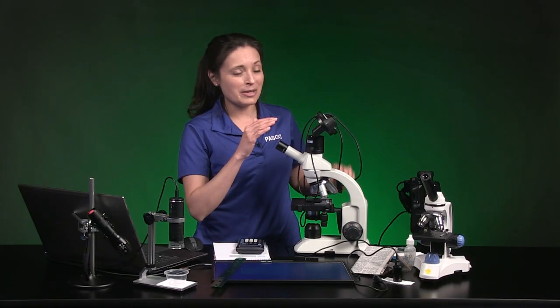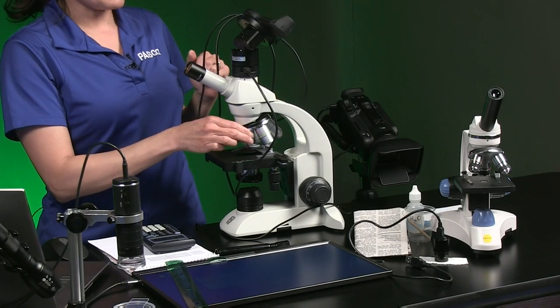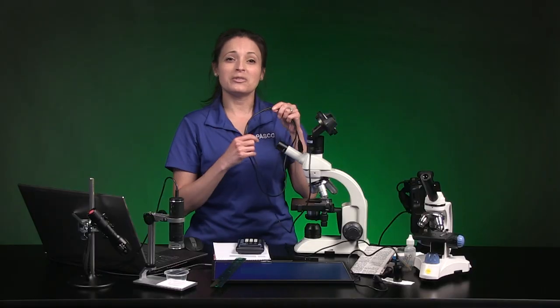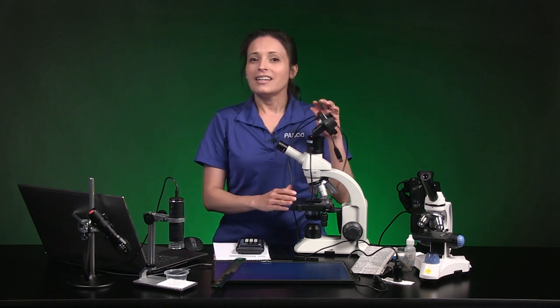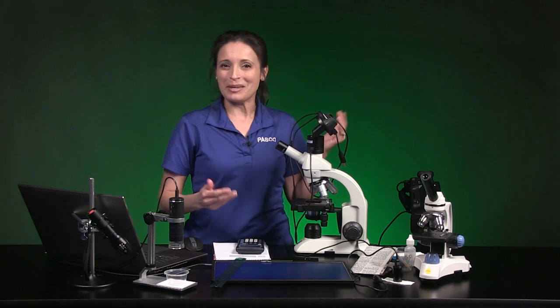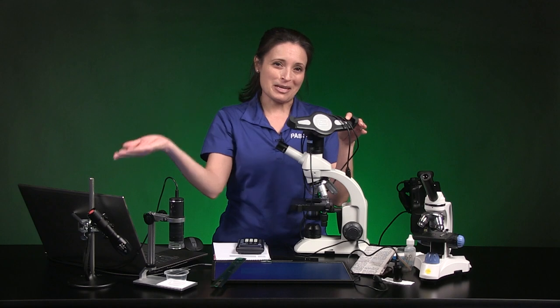Or you might be using a compound microscope like this, where the eyepiece remains in place, but between the eyepiece and objective lenses, a mirror reflects the magnified image into a digital camera feed, so I can either see a traditional microscope view through the eyepiece or I can look at the digital video feed. If I wanted to, I could see both images at the same time. And this piece up here is to mount a tablet if that's where I want to send the microscope feed instead of a laptop.